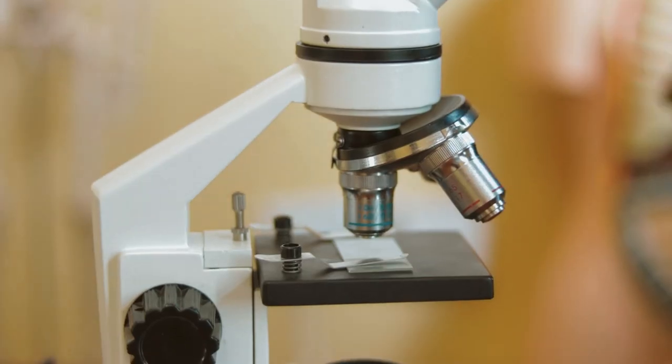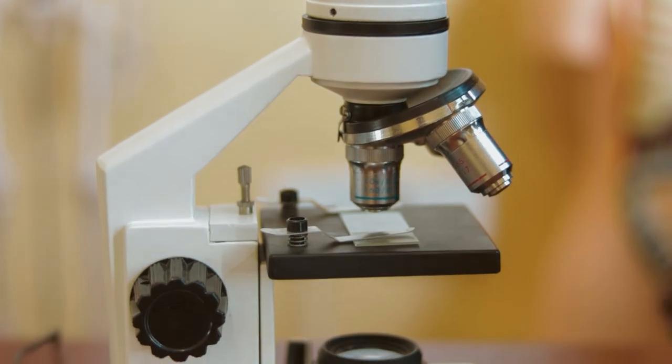In conclusion, microscopes are tools that are used to see tiny objects that are seen beyond what is visible by our naked eyes. Without microscopes, we couldn't know the existence of cells, how plants grow, or even how rocks change over time.